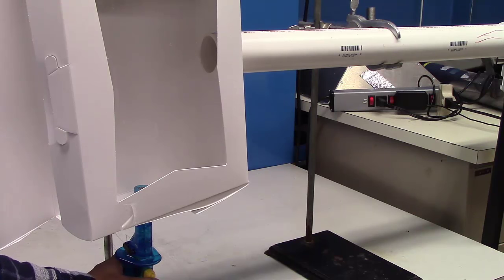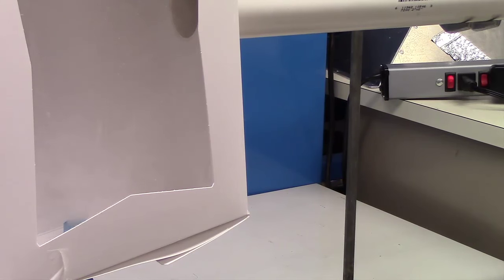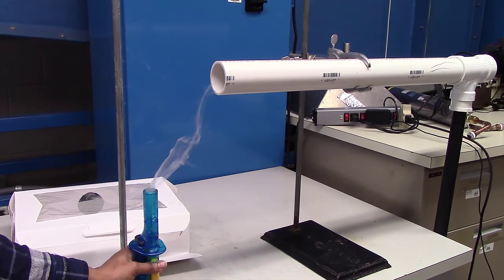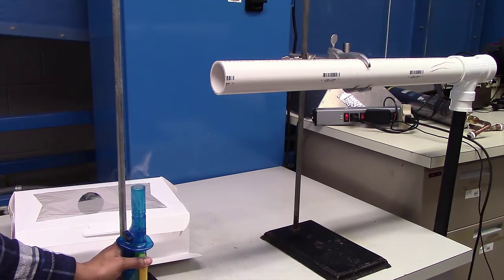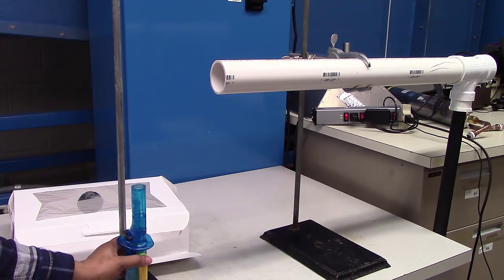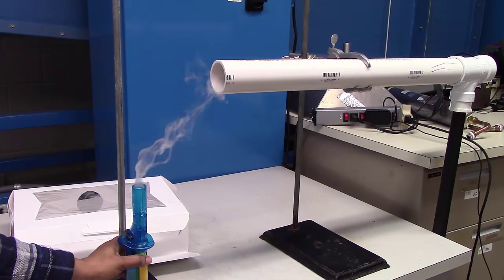Turn on the vacuum cleaner and press the wizard stick trigger firmly to generate a steady stream of fog. Watch the movement of the fog and estimate the fraction that is captured. In this case, all of the fog is captured. What if the kick box was removed and the ensemble is now acting like a capturing hood? We can see that less fog is captured without the kick box than with the kick box. The main difference is that with the kick box, the air is contained and the smoke cannot escape, allowing the velocity in the hood to move the air without much difficulty. Without the kick box, however, the smoke easily escapes, especially as the distance between the wizard stick and the hood opening is far apart. Due to this distance, the velocity supplied by the hood is not sufficient to capture the fog into the duct.